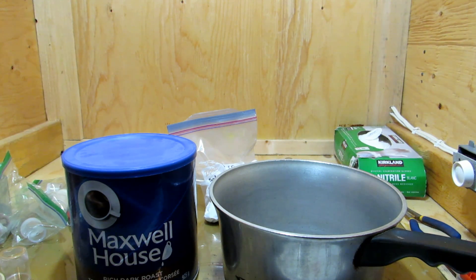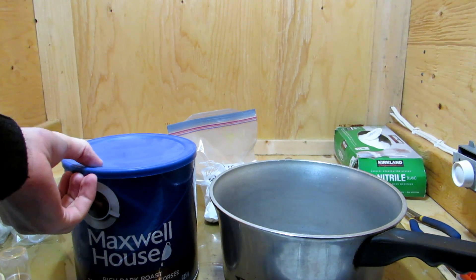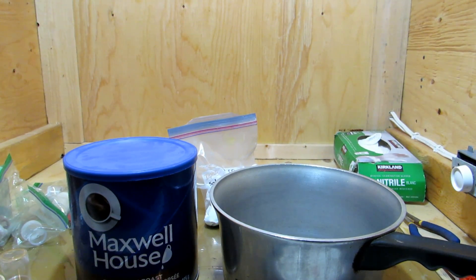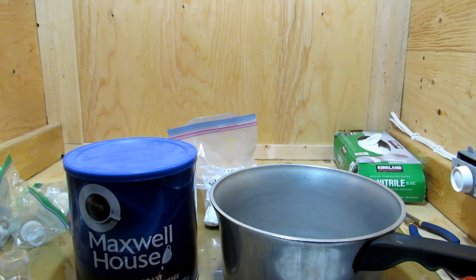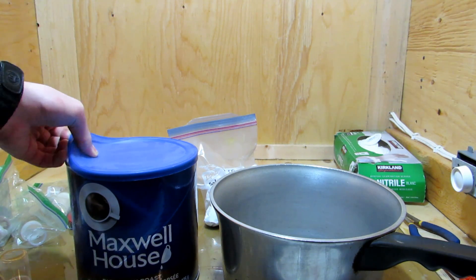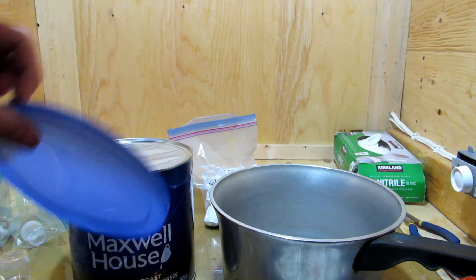Hopefully we'll get more than one gram. I did this extraction in the past with about 30 grams of caffeinated tea and got only 0.001 or maybe 0.01 grams of caffeine. It really wasn't very much, but we're going to be doing this on a far larger scale.